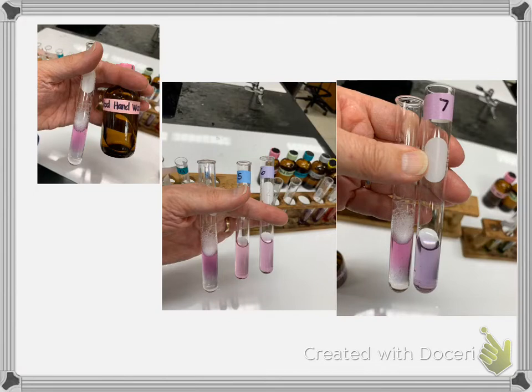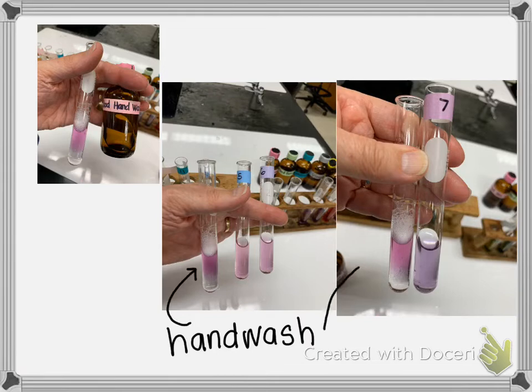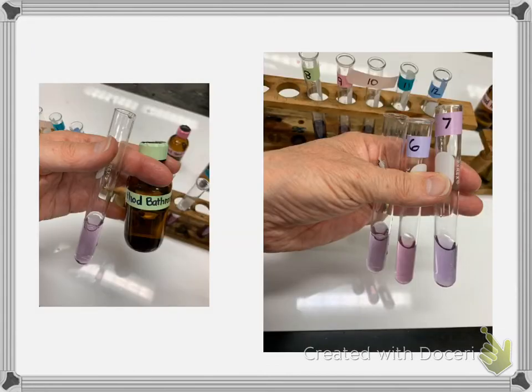This second one is a method hand wash. Look at the color, not the colorless part at the bottom. And you can see here I have 5 and 6 in the first picture, and then I compared it to 7 as well. This is a method bathroom cleaner.